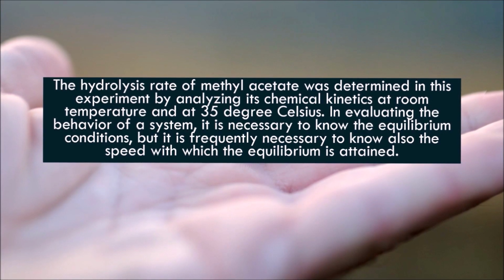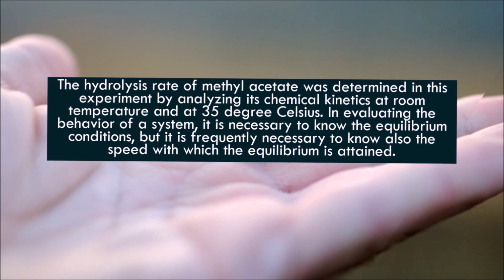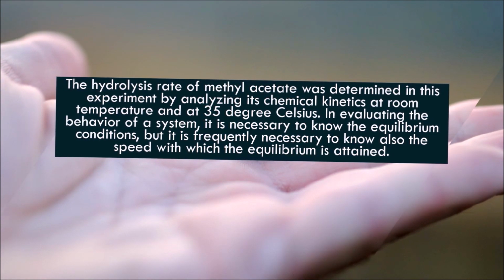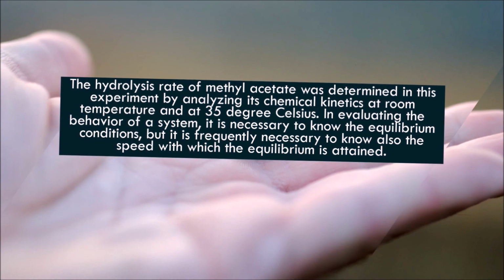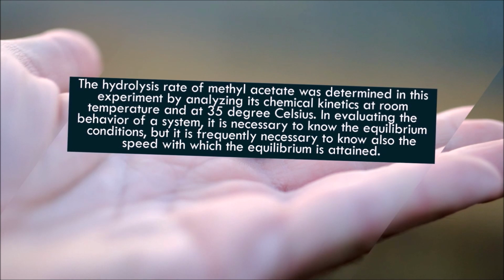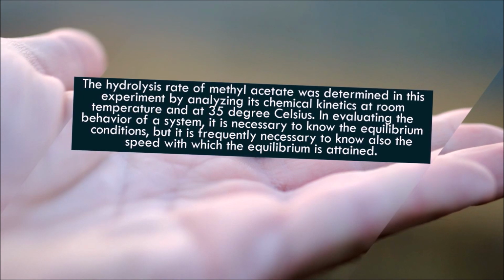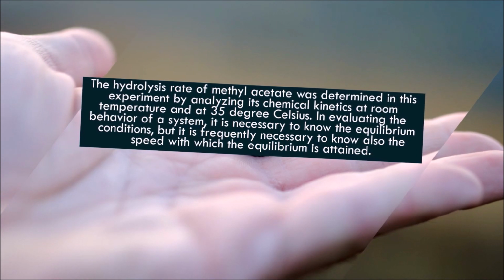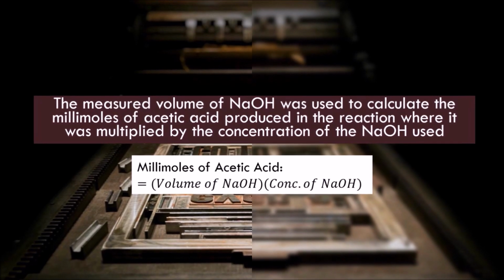The hydrolysis rate of methyl acetate was determined in this experiment by analyzing its chemical kinetics at room temperature and at 35 degrees Celsius. In evaluating the behavior of a system, it is necessary to know the equilibrium conditions, but it is frequently necessary to know also the speed with which the equilibrium is attained. The results are treated as follows.